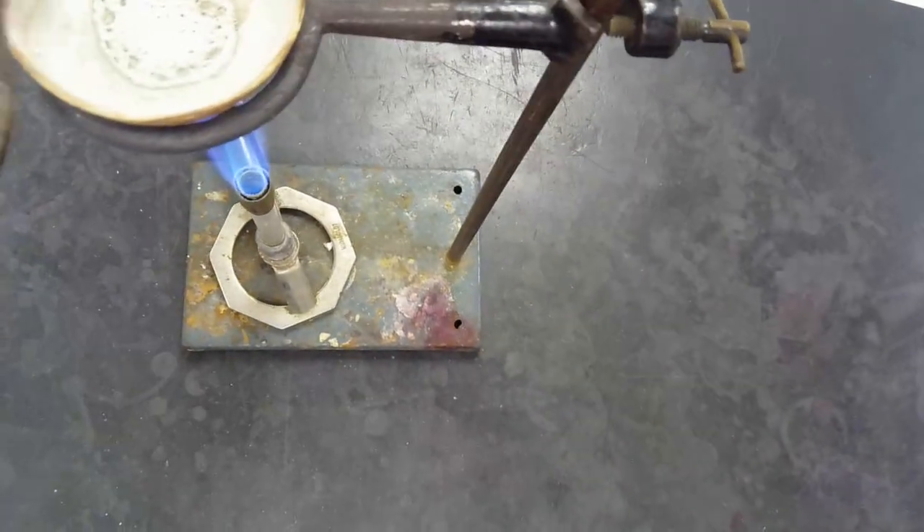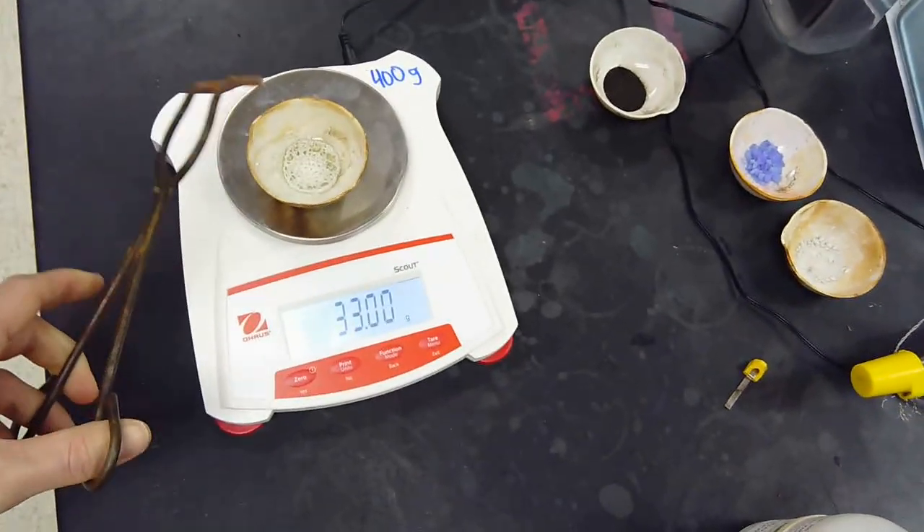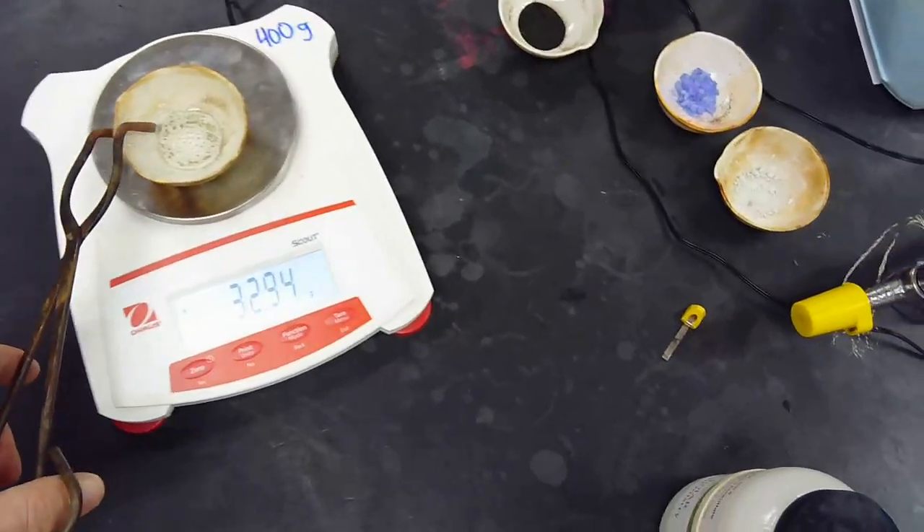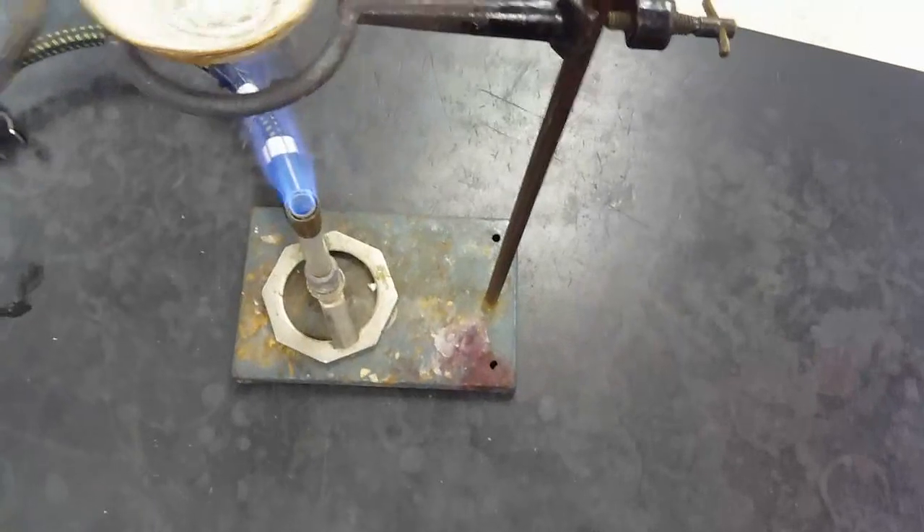Actually, let's take that quick. Let's get one more mass. Not that much different. Put it back on.